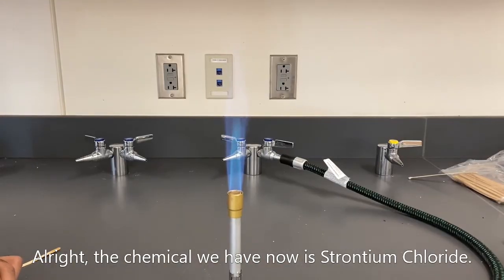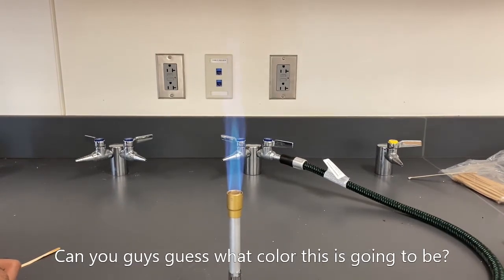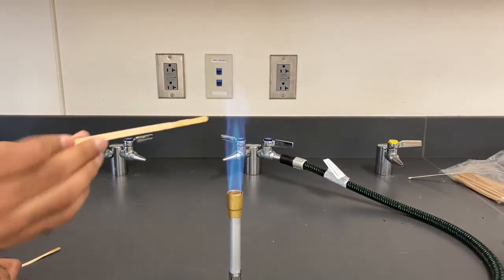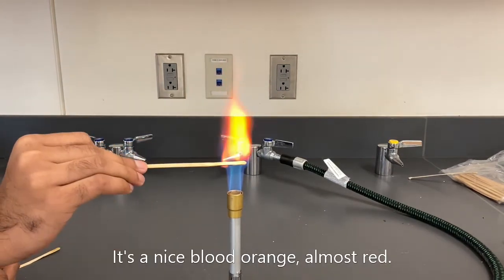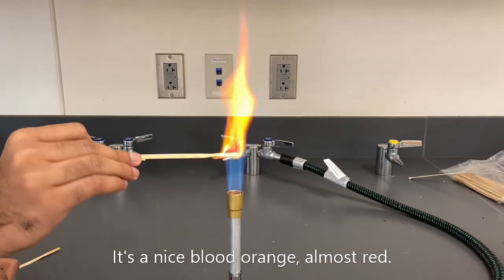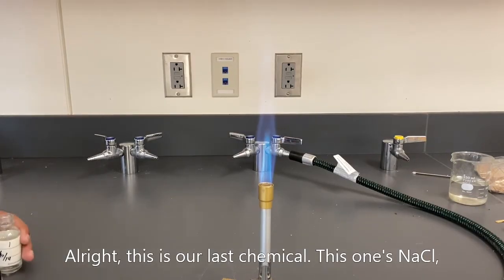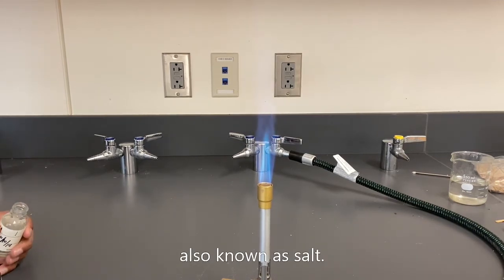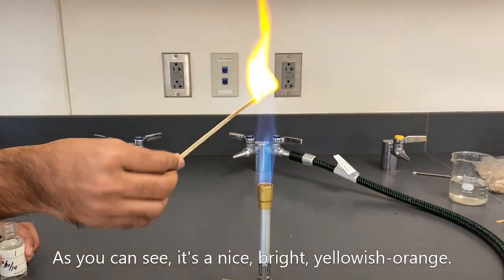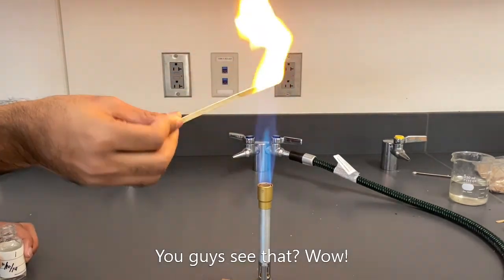Alright, the chemical we have now is strontium chloride. Can you guys guess what this color is going to be? Wow, it's a nice blood orange, almost red. Alright, this is our last chemical. This one's NaCl, also known as salt. As you can see, it's a nice, bright, yellowish orange. You guys see that? Wow.